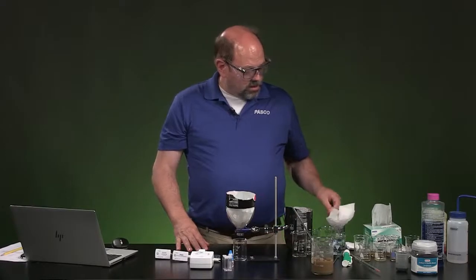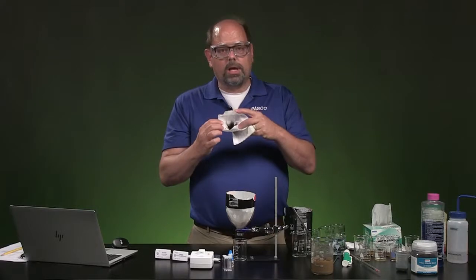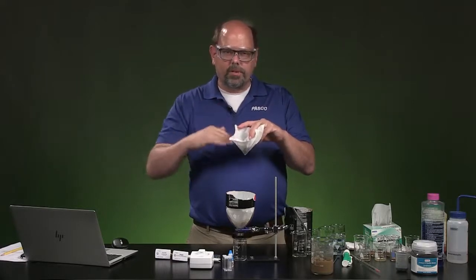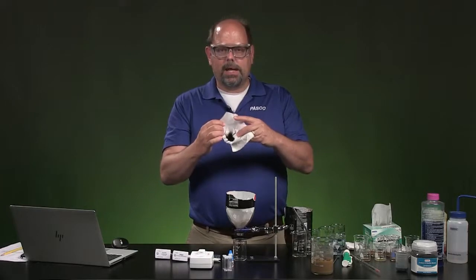What I will mention in this stage, though, is for one of your filterings, here's what it looked like when I poured that activated charcoal in first, and then I rinsed it two or three times to get anything that's loose to filter through and be out of the way. Then what's left impregnated on the sides is that activated charcoal.